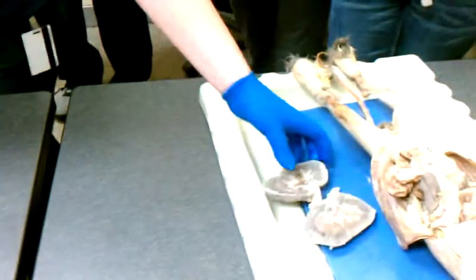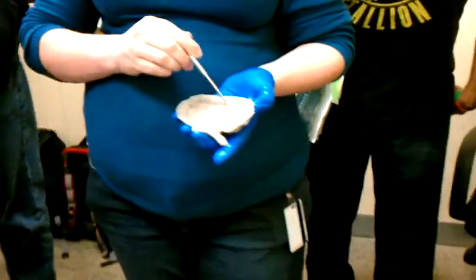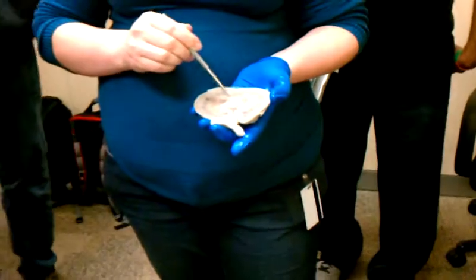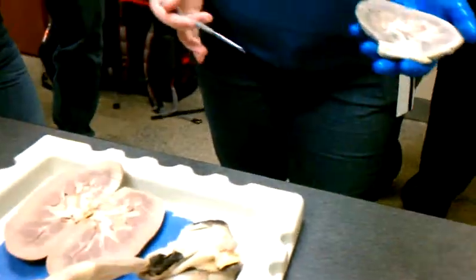There's also, some of you had different kidneys, so I brought one of each for you to compare. You can still see the differences. In this one you still have the lighter cortex area, darker medulla, broken up into pyramids, minor calyces, major calyces, pelvis. Same structures, but it looks just a little bit different.